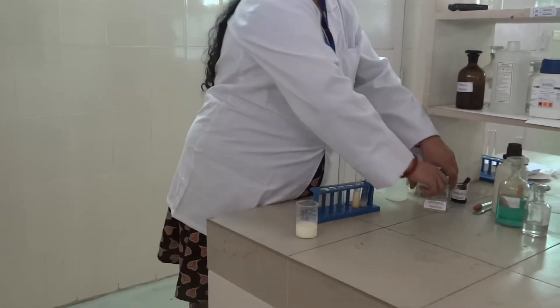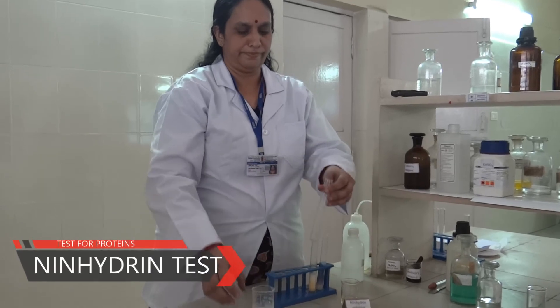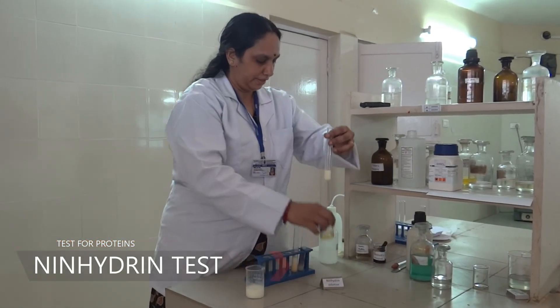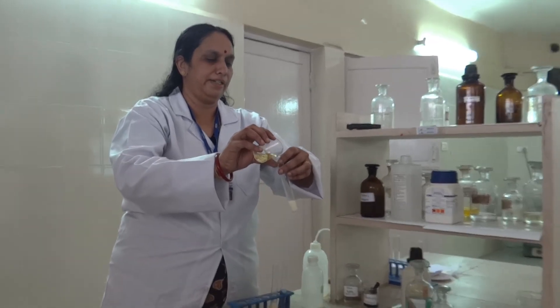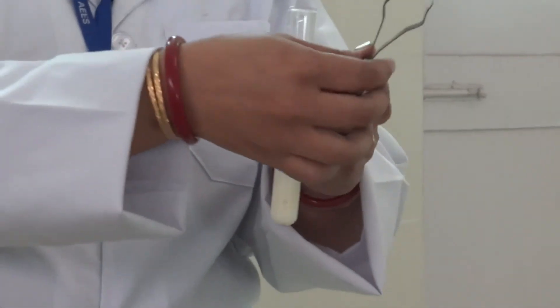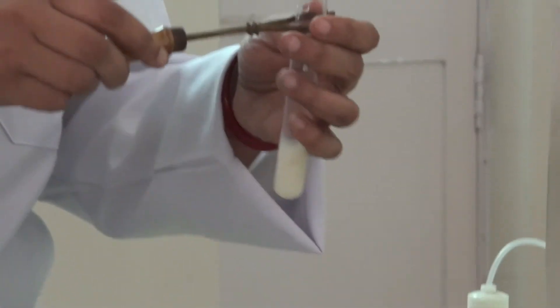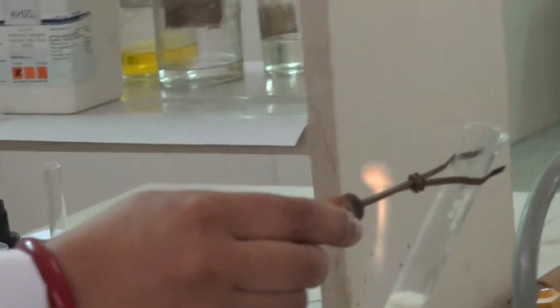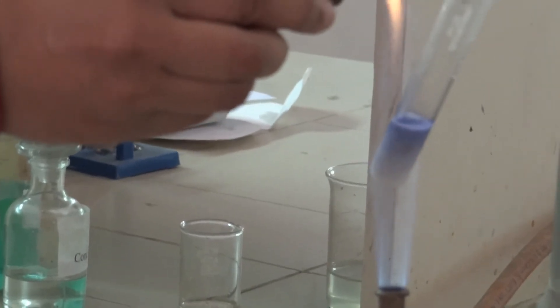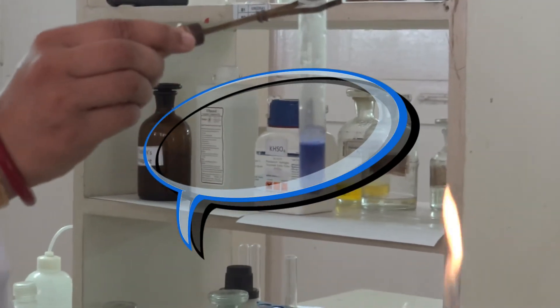The third test is the test with ninhydrin solution. Let's take the protein foodstuff and add a few drops of ninhydrin solution, then gently heat the contents. You will see that the colour changes to a deep blue colour, proving the presence of proteins.